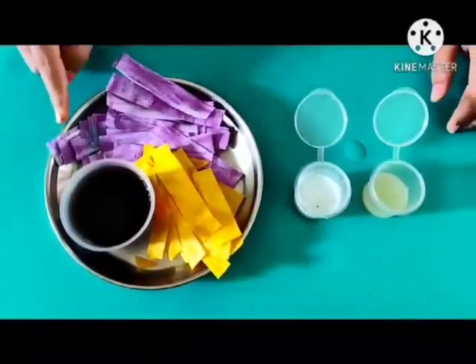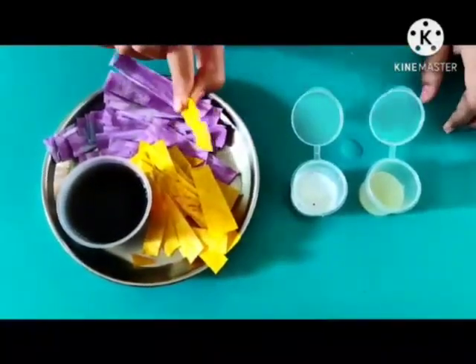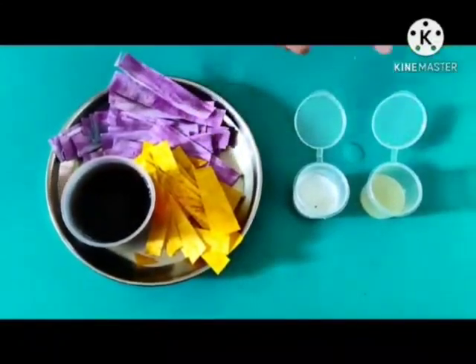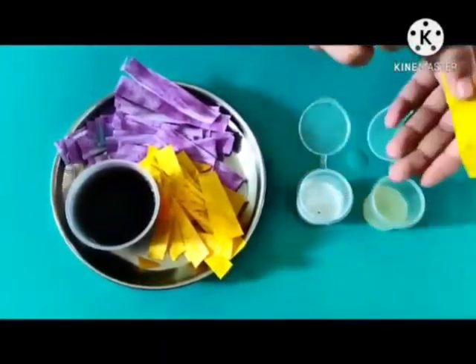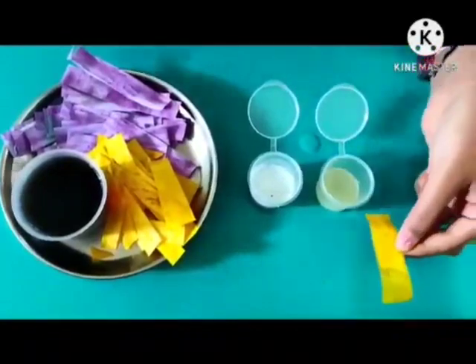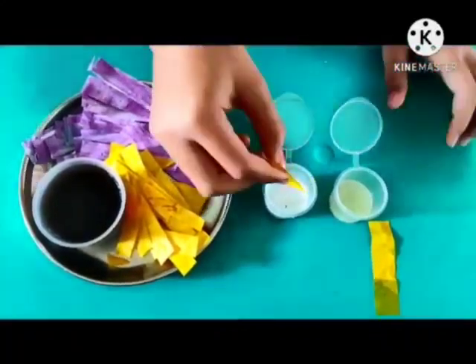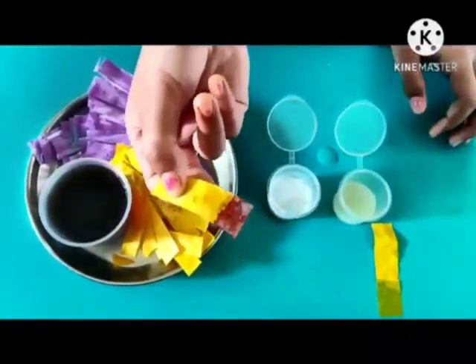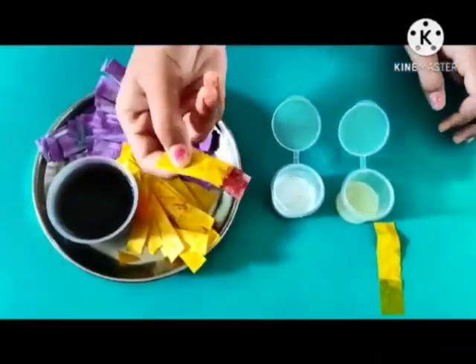Our natural indicators are ready. Let's test them with different samples. Here is our turmeric indicator paper. If the solution is basic, its color will change into red. First, I will add it into lemon juice. We can see that it is not showing a particular color change in lemon juice, so we can say that lemon juice is an acidic solution. Now let's test with washing powder solution. We can see that its color changes into red, so washing powder solution is a basic solution. Turmeric indicator paper shows red color with all bases.